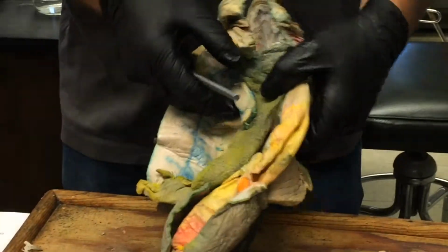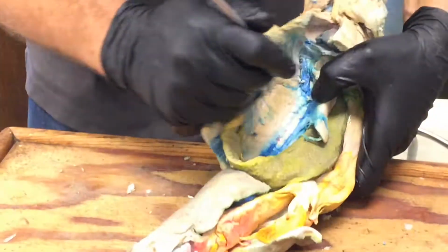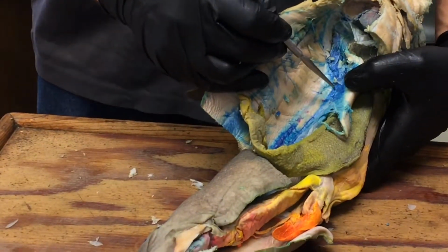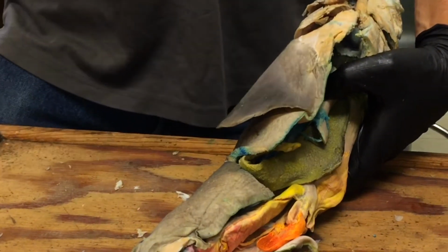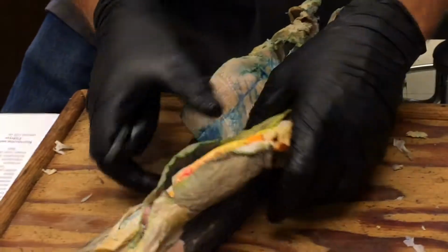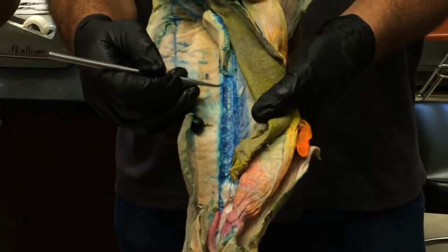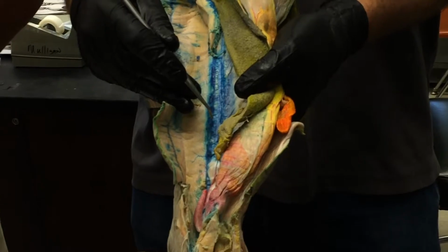Okay. And if you look carefully in that mesorchium, sometimes you can see, and this is not going to be a good chart for it, but you can see little tiny ducts running along through the mesorchium, and those are the so-called ductuli efferentes that carry the sperm out of the testis to the archinephric duct. The archinephric duct itself runs along on the ventral side of the testis here, and this one's got a lot of blue in there, but if you see the white thing that's all kind of coiled up and convoluted, that's the archinephric duct. And have you exposed that on yours?